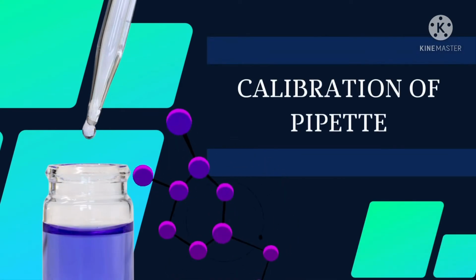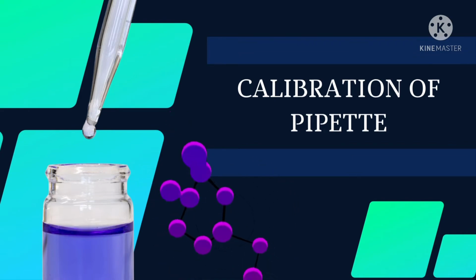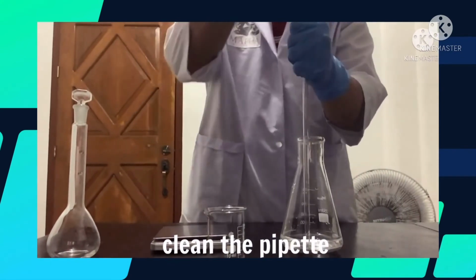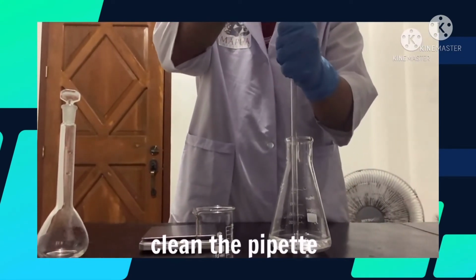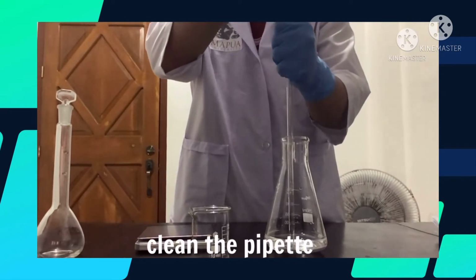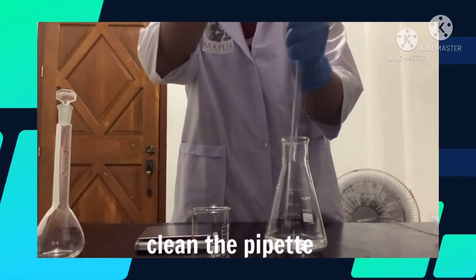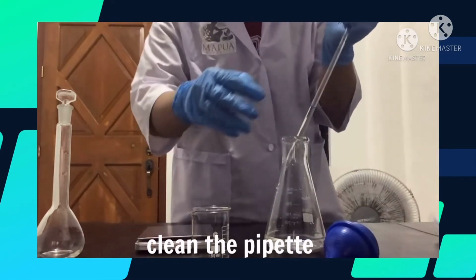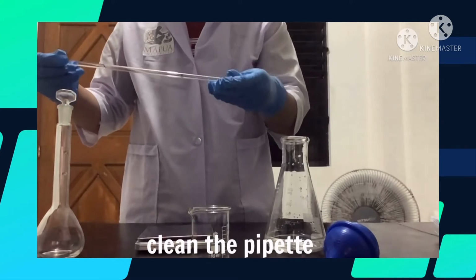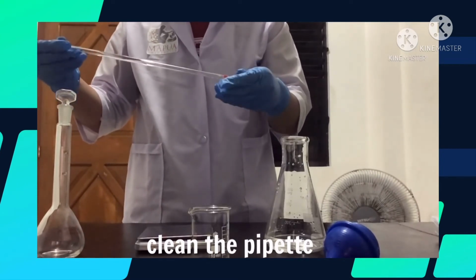Second to the last, the calibration of the pipette. First, for the calibration of pipette, clean a 10 ml or a 5 ml pipette. When a pipette or any volumetric glassware is cleaned properly, no droplets of reagents remain on the internal surfaces when they are drained. This is very important for accurate and reproducible results.